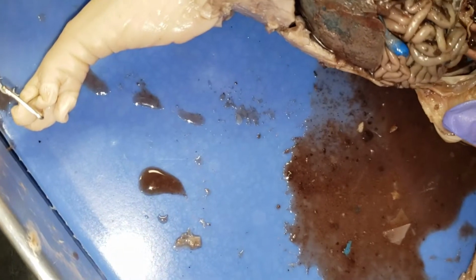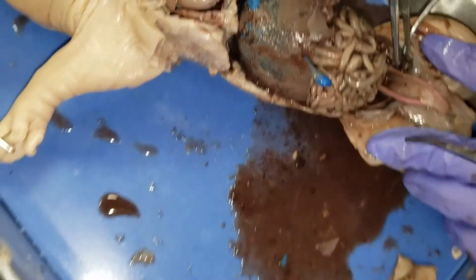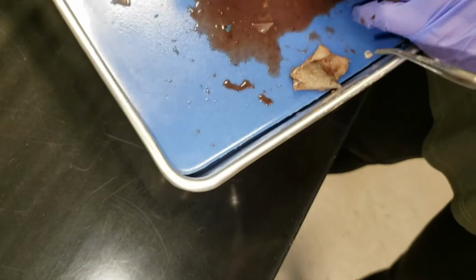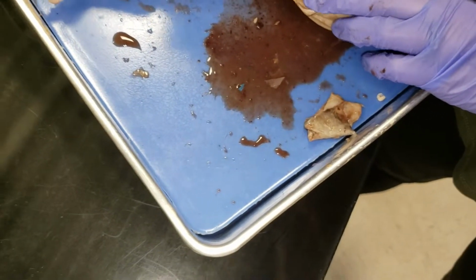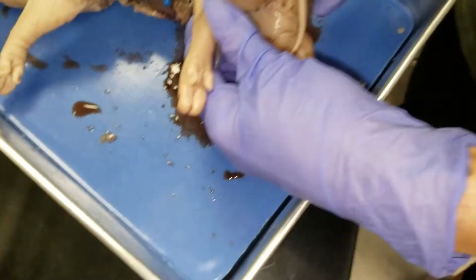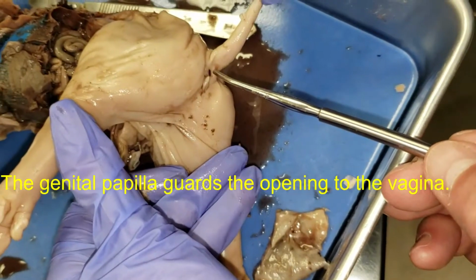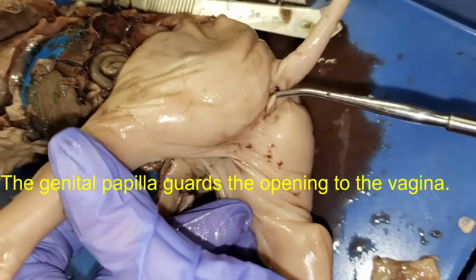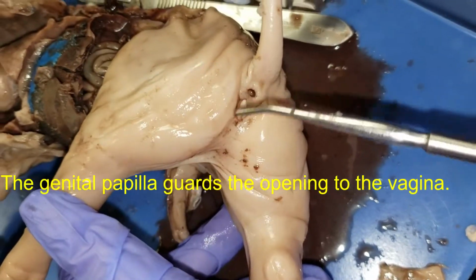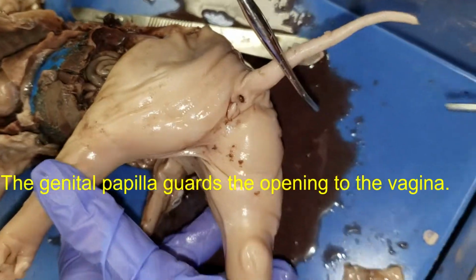Bladder right here. That looks pretty good. Okay, now let's look at her around her tail. Let's see about her body parts. Here's her anus, and her vagina would be in front of this. Little part right there is the entrance to her vagina.